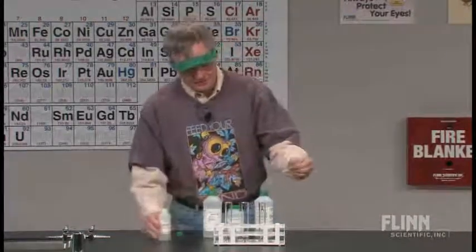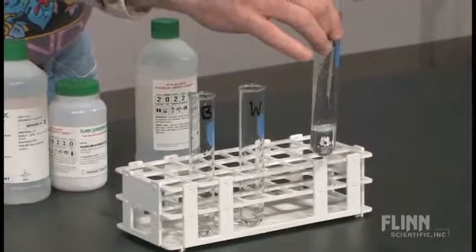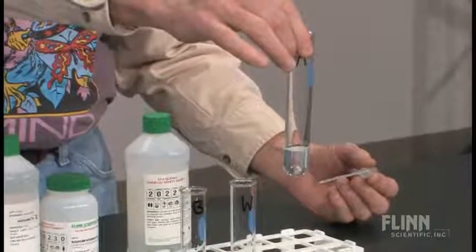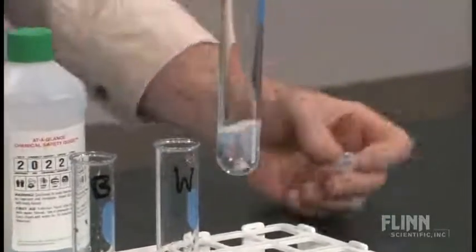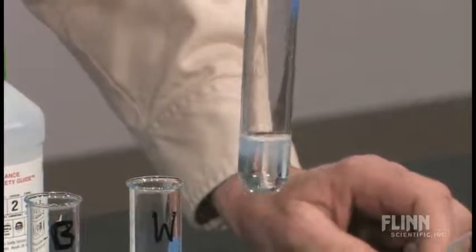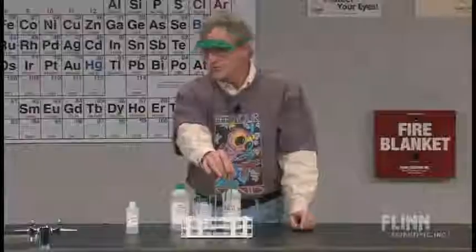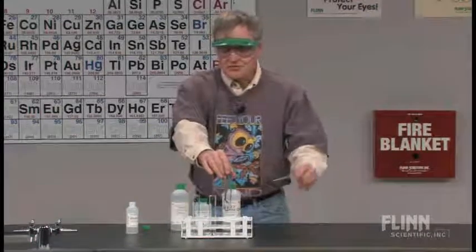When I put the phenolphthalein in the acid, something kind of interesting happens — you see that cloudiness. Let me put another drop or two in there. This is an interesting phenomenon itself, and your students may see this when they put phenolphthalein in water, or in an acid solution, or in any solution they're working with. It gets a little bit cloudy.